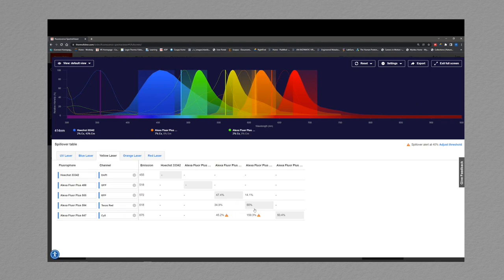Now, obviously, in some cases, spillover is going to cause significant issues, but in other cases, like here with Alexa Fluor 555, using the yellow laser, a small amount of spillover shouldn't affect your end experiment too much. And there's ways to get around doing this. If you were to choose a high abundant target, like, I don't know, tubulin, and put that in this Alexa Fluor 555 channel, then you could use a much lower exposure setting, and the chances of picking up whatever target you had in the 594 channel would be minimal.